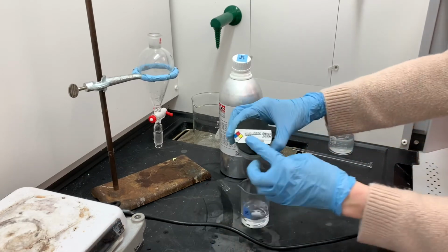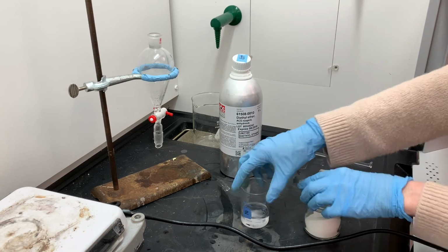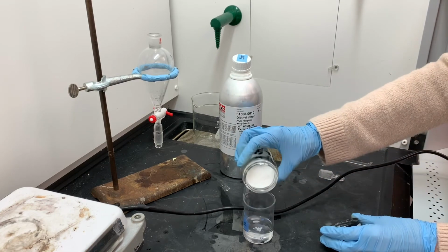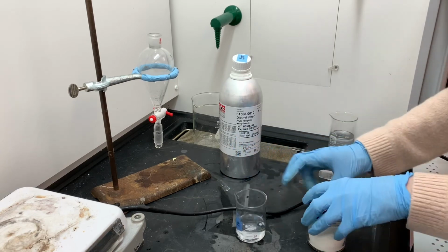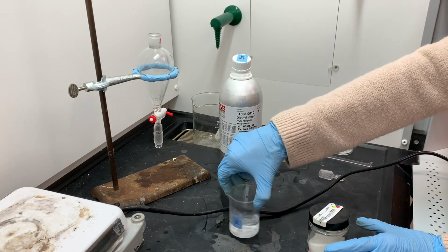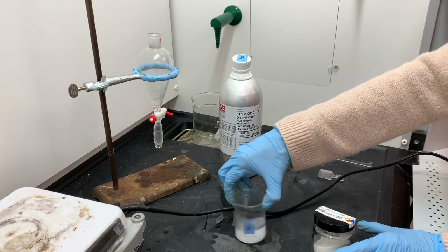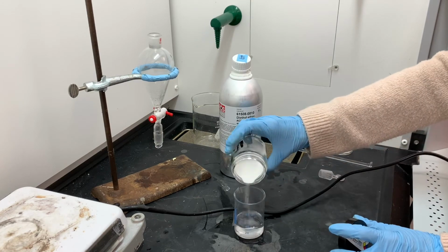So knowing that I'm going to have to put quite a bit in, I'm just going to be pouring some in. Normally I would just use a scoop to put a little bit in at a time. And what I'm looking for here is for the anhydrous sodium sulfate to stop clumping. I want to be able to pour some anhydrous sodium sulfate in and have it remain just granulated and not clump up. The portions that have already clumped will remain clumped, and what I'm looking for is the new stuff that I put in to not join in on the clumping.